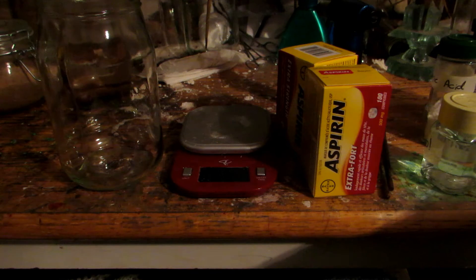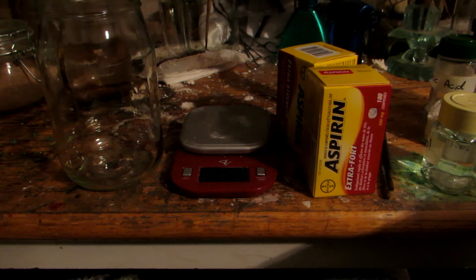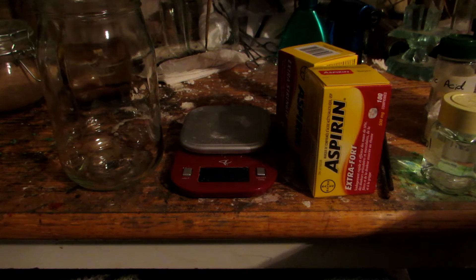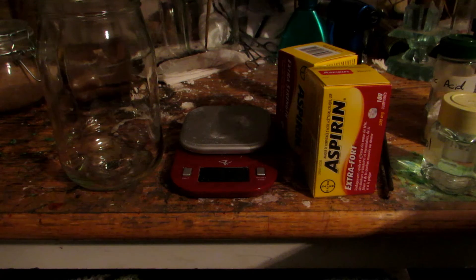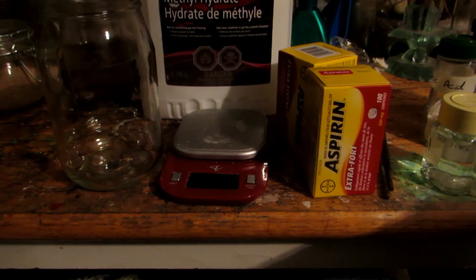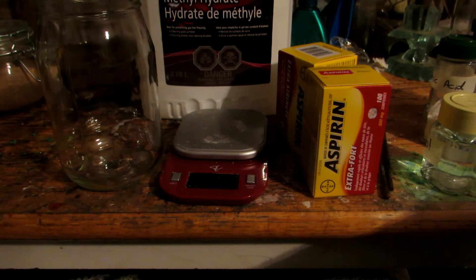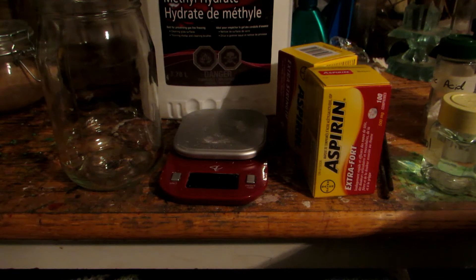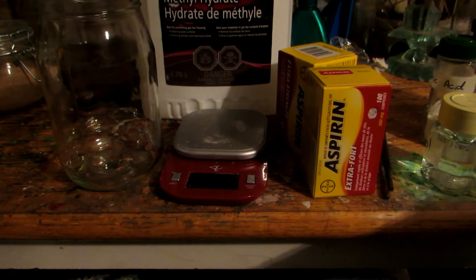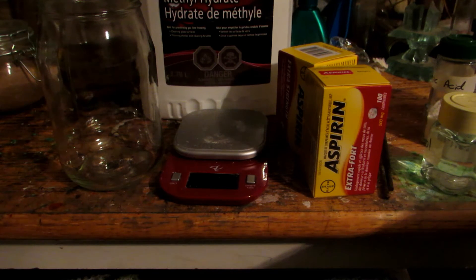I looked at the solubility of acetylsalicylic acid with a couple of different solvents and decided to use methanol because it's the cheapest option. I recently went to Home Depot and bought another four liters of it for about ten dollars. It's extremely cheap and a very useful solvent. You can find it at Home Depot or Canadian Tire under the name methyl hydrate or methyl alcohol — it goes by a couple of different names.